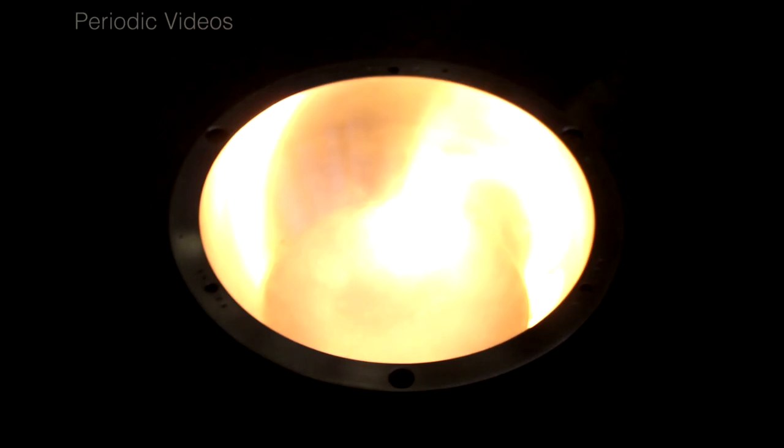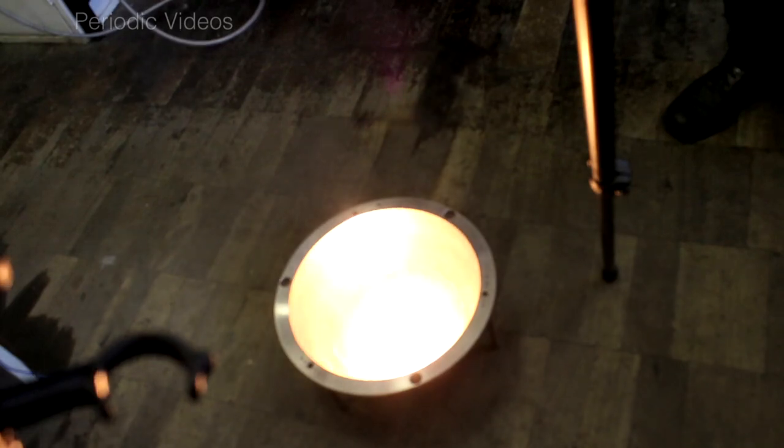When it's dropped in, the ordinary video camera completely whites out. Looks really good, looks as if the whole world has ended. But the thermal imaging camera looks at very much more selective wavelengths, so you can actually see what's happening to the piece of charcoal.